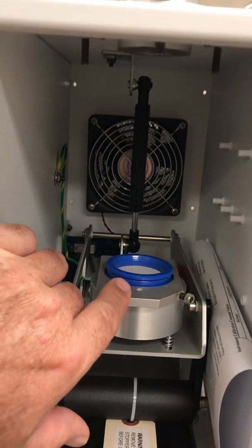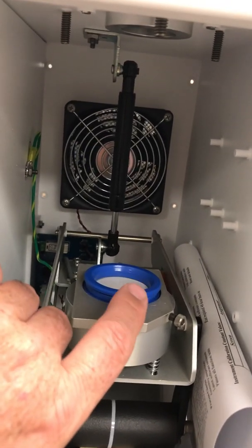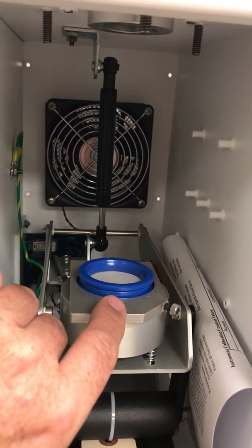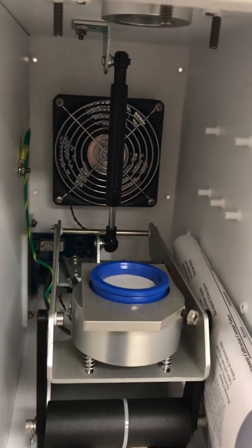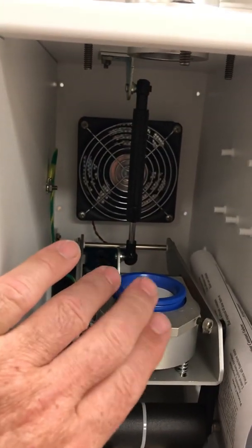After the 24-hour period, the technician will come out, remove the filter, and send it back to the lab. The lab will weigh it again, and just on that weight difference from the pre-weight, they can calculate the amount of particulate that has landed on this filter. So it's a weight analysis and a 24-hour sample operation.